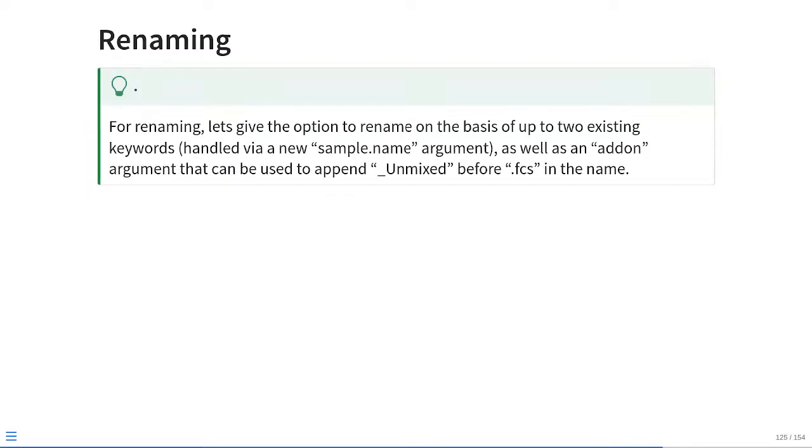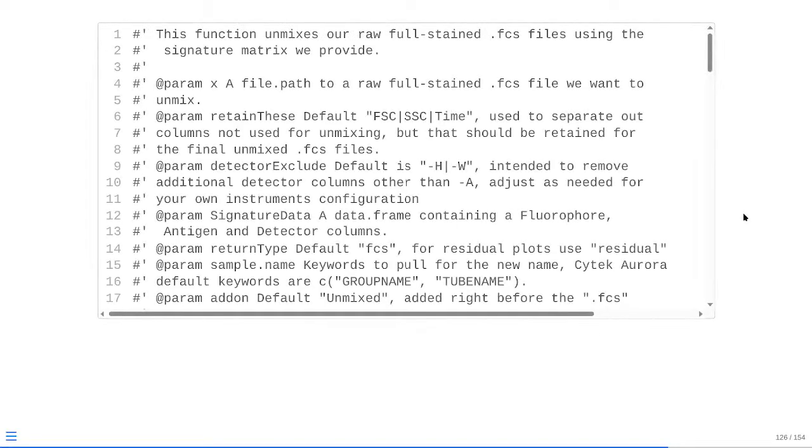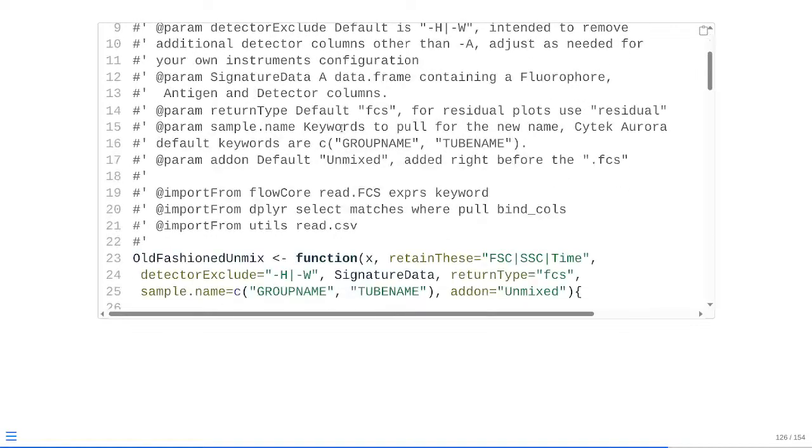So, for renaming, let's give it an option so that we can rename on either one keyword or two keywords, like if we wanted to use both group name and tube name in the final file name itself. Additionally, we want to be able to avoid accidentally overwriting the raw FCS file, so we should add another argument in terms of add-on, which will append on the _unmixed before the .fcs in the name so that it's all working properly.